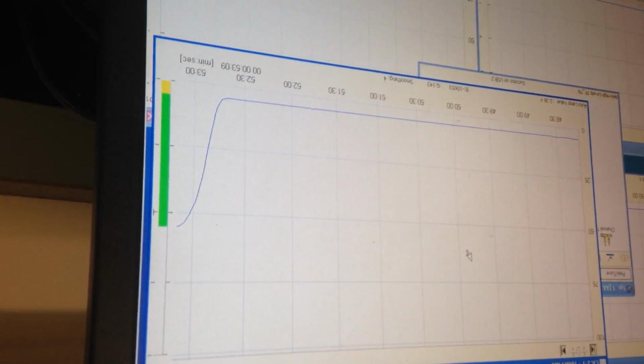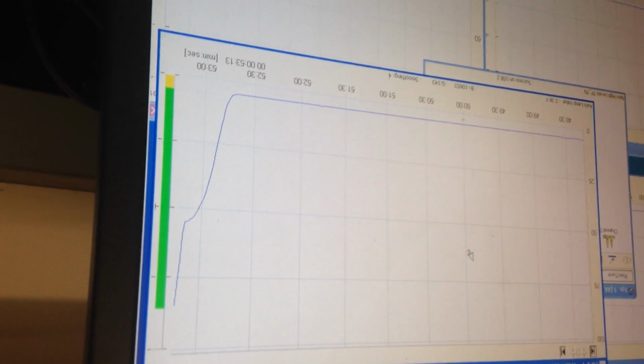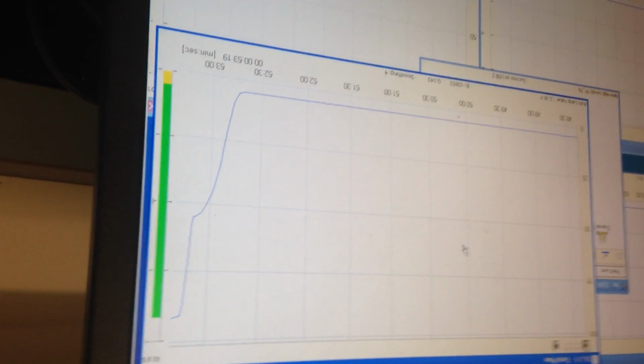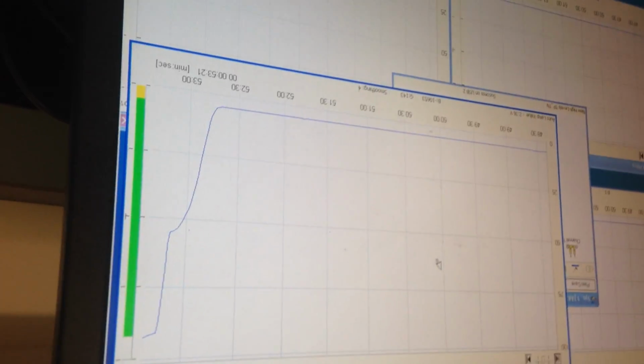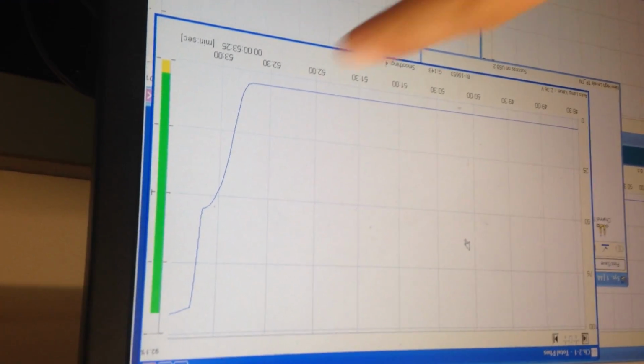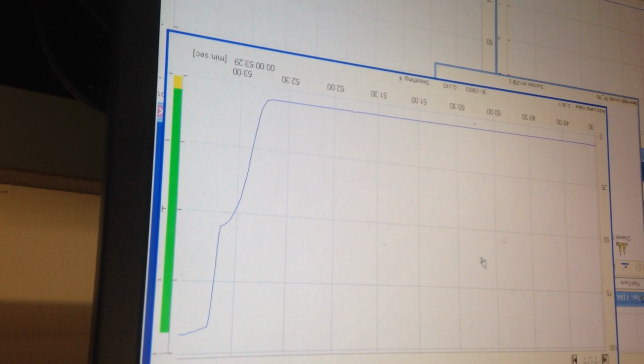In this case, it's a gain of around 50. Yeah, because it looked like it was going to plateau at around 50-60%. So I wanted to set gain to make sure. That's a difference with respect to that gain. Yes. It was 85. Well, I still want it. So I think it's a kind of a weak signal.